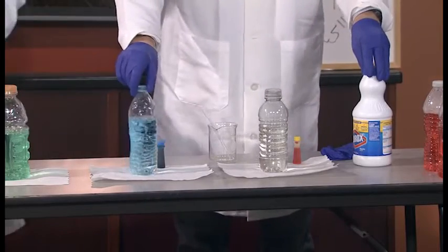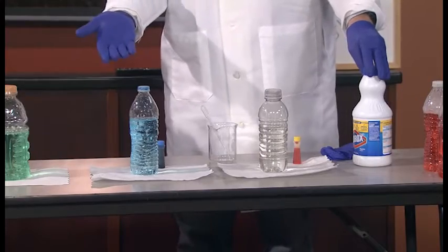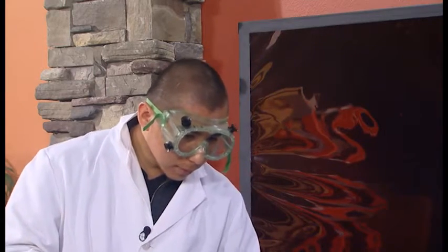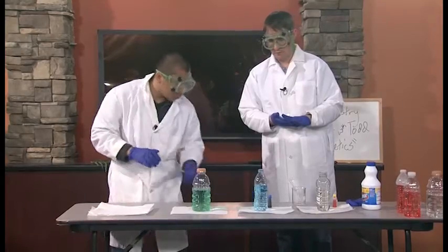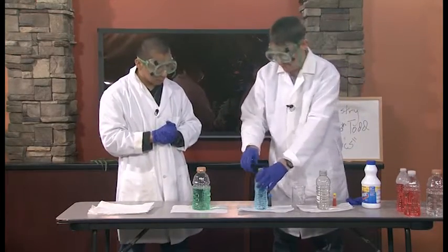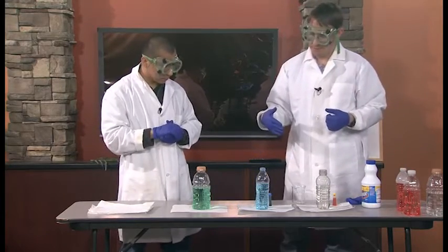You're exactly right. As opposed to the blue food dye, we add the same amount of bleach, and it's been about 20 or 30 seconds at this point. Right. And what can we say about the color in the blue bottle? It's beginning to be a little bit less bluish at the bottom, but not much. Yeah, I agree with that. It's starting. It's still definitely blue. Yeah. But it's starting to fade a little bit.